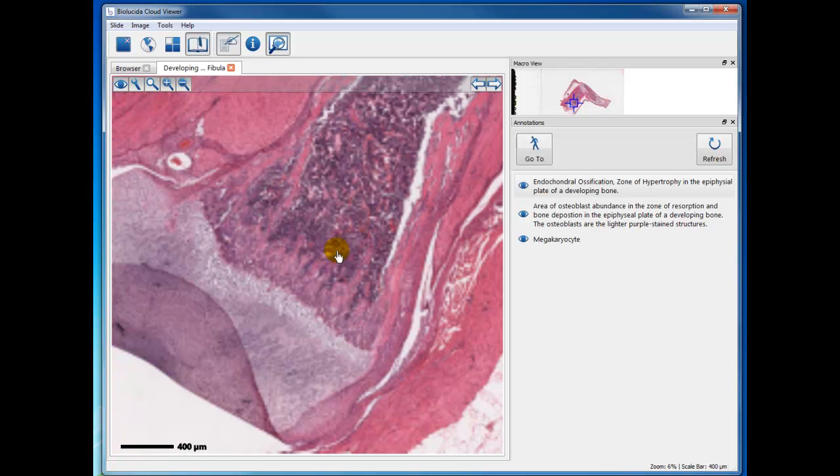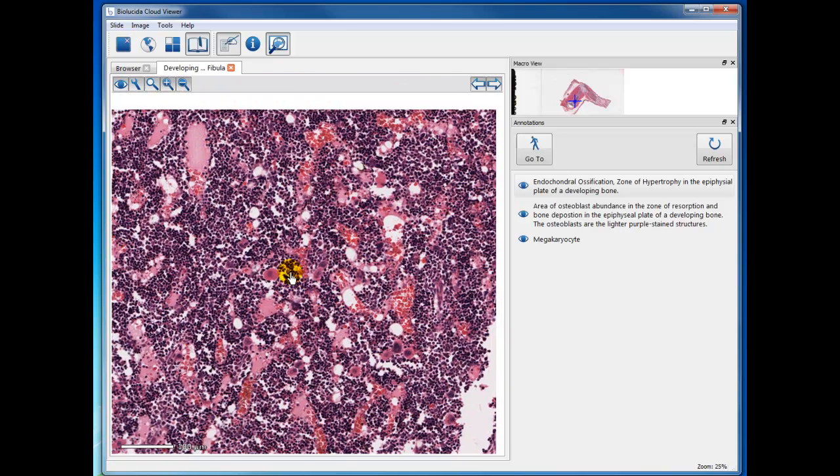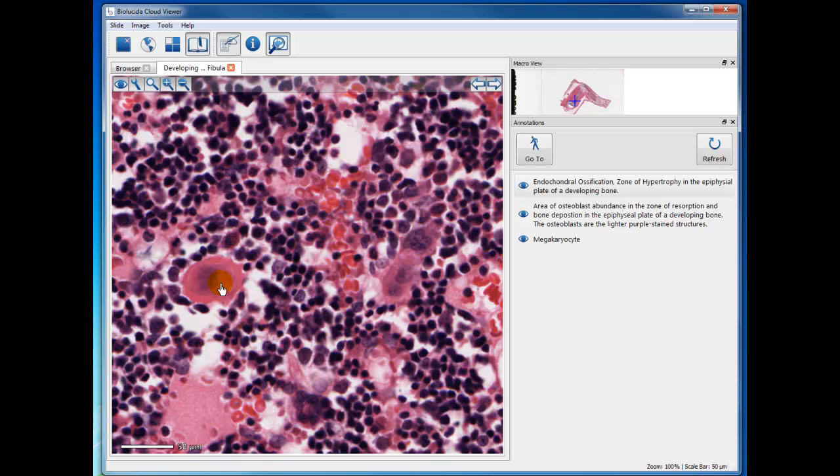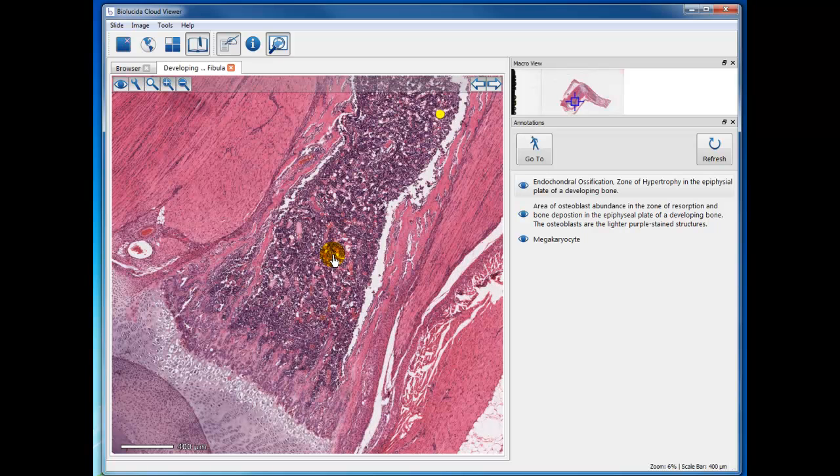So in this area down here where the bone marrow is, you find a good place to see megakaryocytes, the large cells that are eosinophilic, and they contain one huge nucleus. It's polyploidal. It contains more than the normal amount of DNA to monitor and control the cytoplasm, the large cytoplasm. And this is a producer of platelets. Actually, platelets are formed by little fragments that pinch off and get into the blood circulation. So this specimen is good for studying bone marrow.